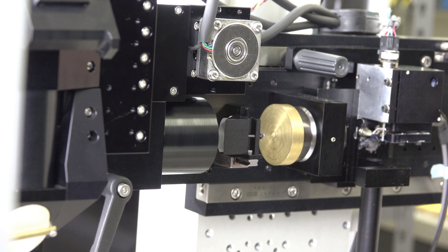If your CCD mirror is in the way, loosen the scan lens set screw and slide the scan lens back just enough to insert the pinhole. Remember to be careful to return the scan lens back to its exact position after removing the pinhole later.